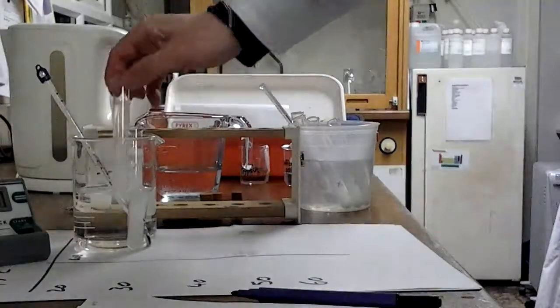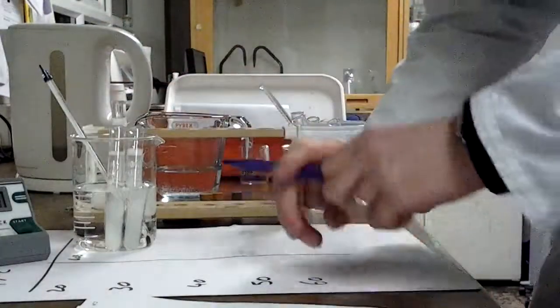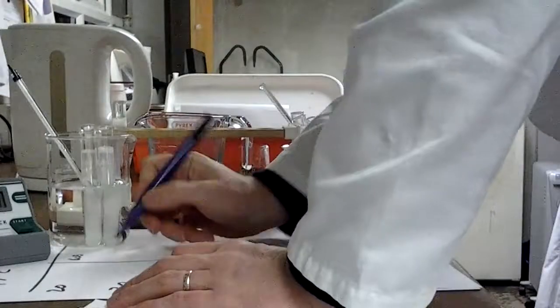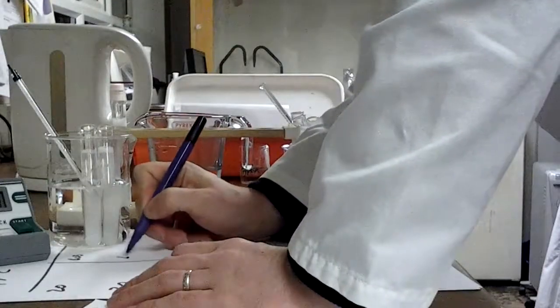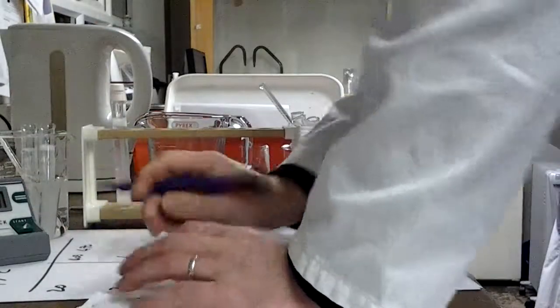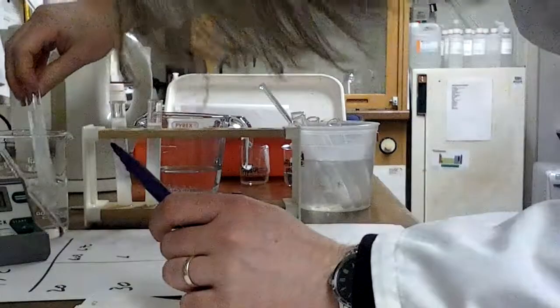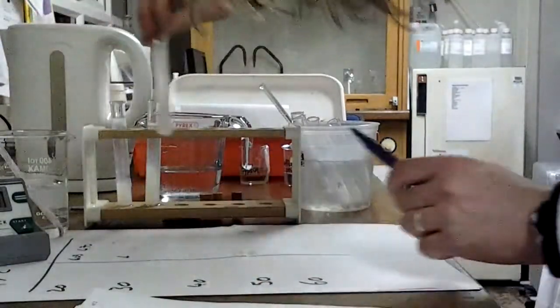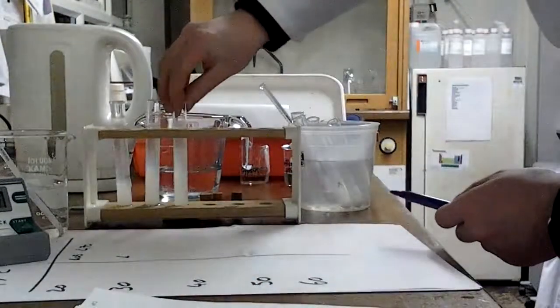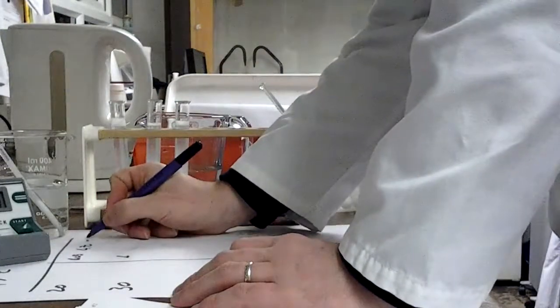Okay, I've now made a judgment. I believe I can see an X through that. Okay, that's 7 minutes 50 seconds. And again, that one, I'm pretty sure I can now see an X through that. So again, I'm taking that one out. And that was about 8 minutes.